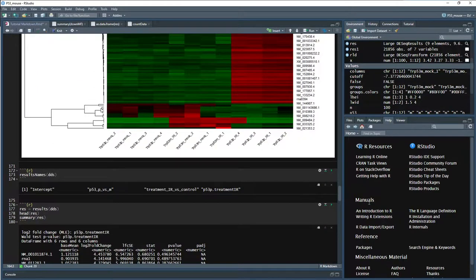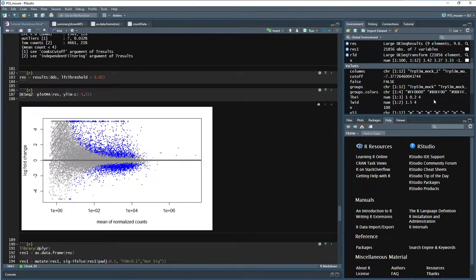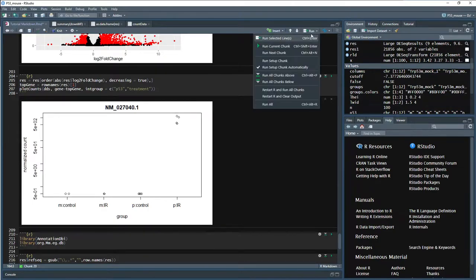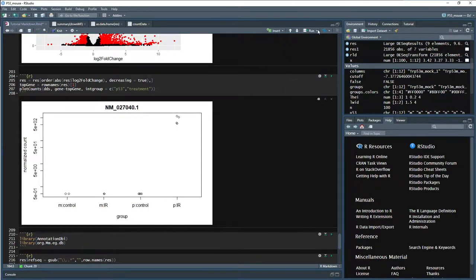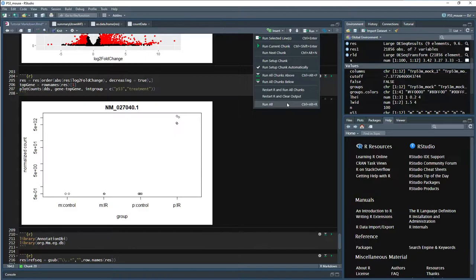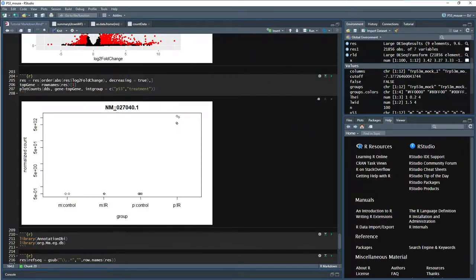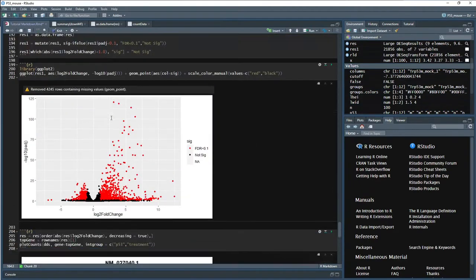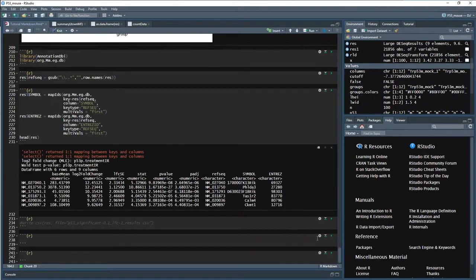It's also really handy too if, say, your global environment is empty and you want to run everything, you can do up here run, and then you can run all. With that error, it'll stop at the heat map and it won't actually run these last 10 chunks or so.